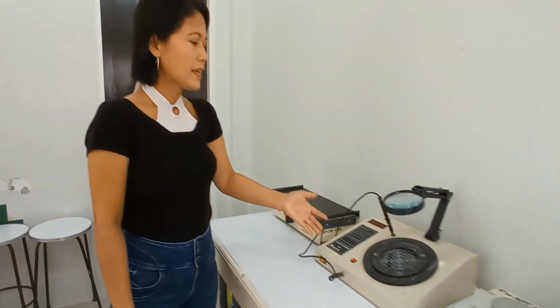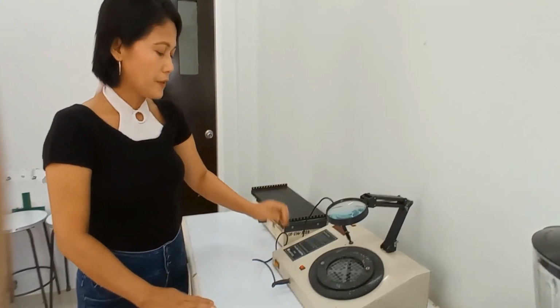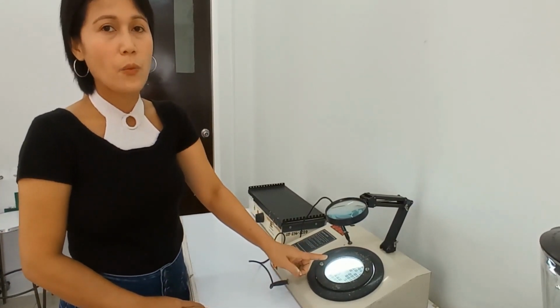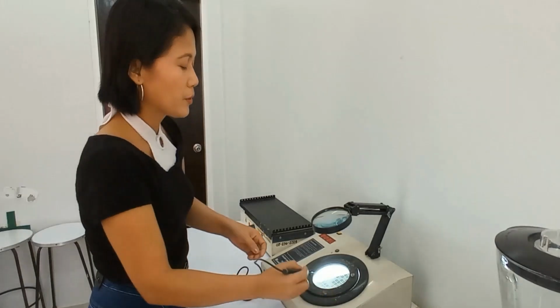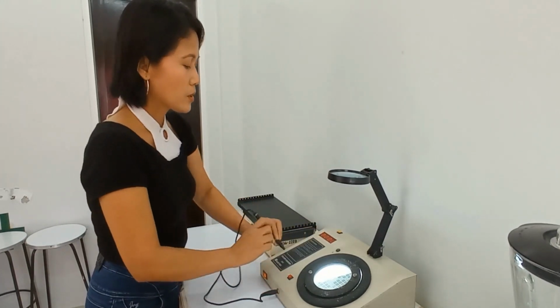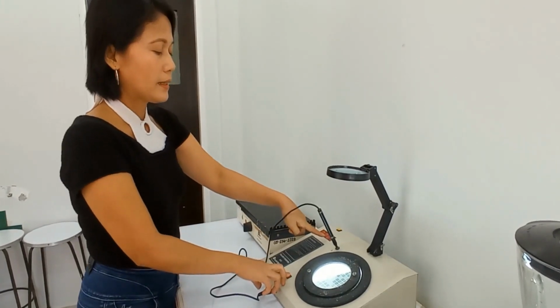Okay. So, this one is our colony counter, another basic one in microbiology laboratory. So, in colony counter, if you turn this on, you have here the area where you put the Petri dish, where you have the colonies to be counted. And you have in here the pen that could mark the colonies where you already have counted, and you have in here the counter. So when you count, like for example, 1, 2, 3, you press 1, 2, 3, and so on. So you don't lose counts.